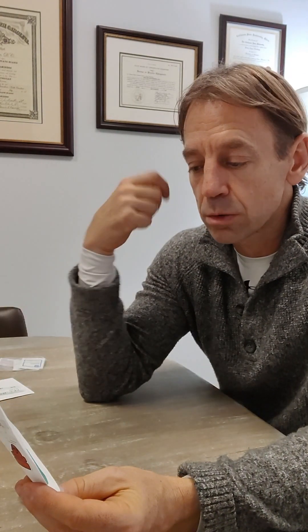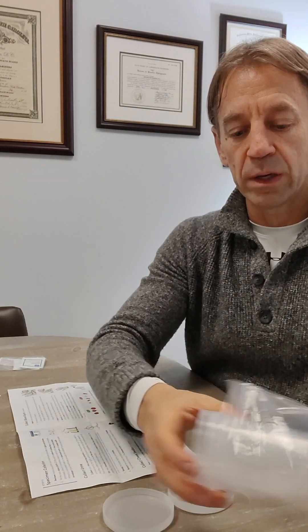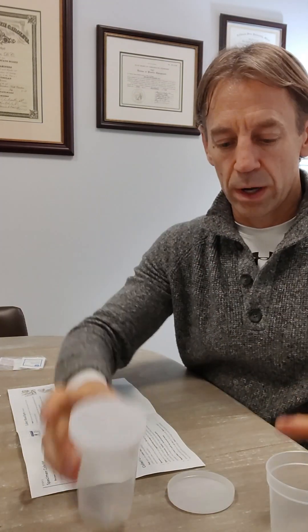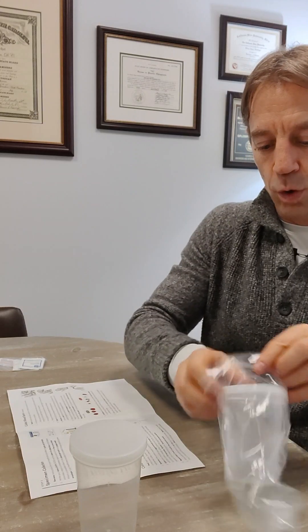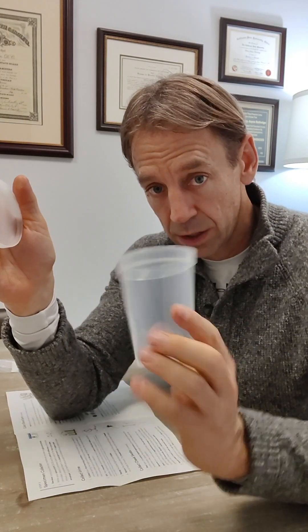You're going to collect the urine, do the cheek swab, and do the blood spot all first thing in the morning. So let's talk about the urine. Take out a cup — there'll be two of them; you really only need one, but there are two in case you need a backup. Take one and put the other aside. Put that cup right by your nightstand or toilet. If you get up in the middle of the night and need to urinate, go ahead and put that in the cup — collect that. That will not be your only collection, though. When you wake up again in the morning, as long as you go within six hours of waking up, you're going to add that urine to your overnight urine, all in the same cup.